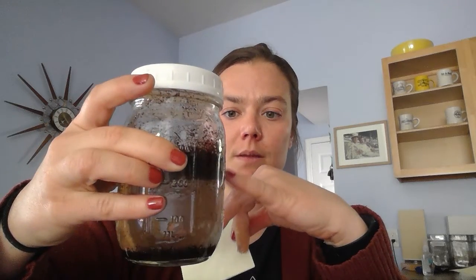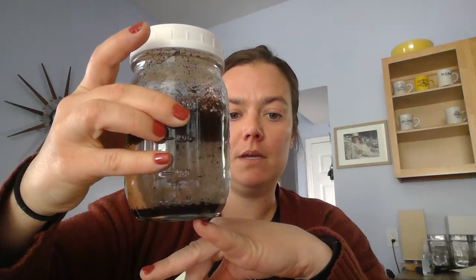All right, sample 3. You guessed it, this is potting soil. Again, really interesting, and this is something to think about if you're trying to get big pieces of stuff like this out. Notice that some of it has floated at the top, these big chunky pieces, and then at the bottom it is separated out and is down there. So is this safe? Thinking about that. And then how might we get this dirt and potting soil out of the water sample?